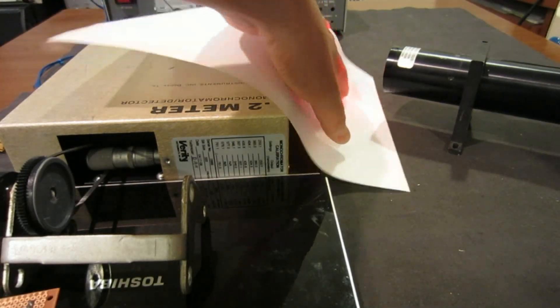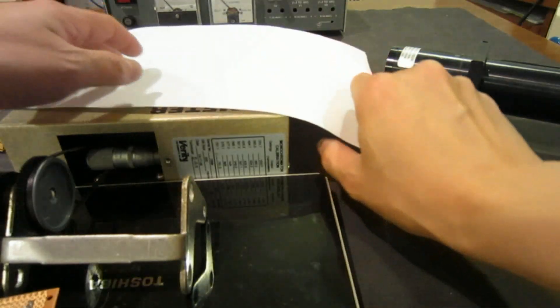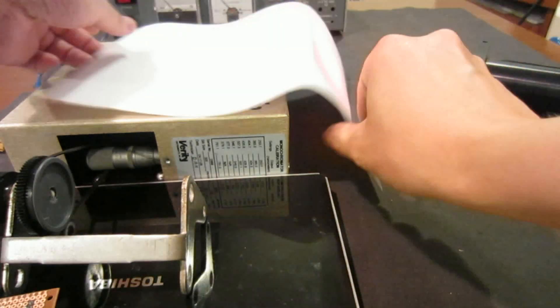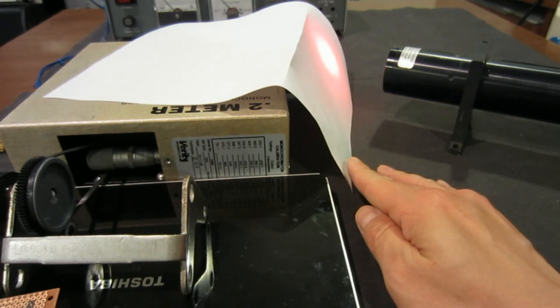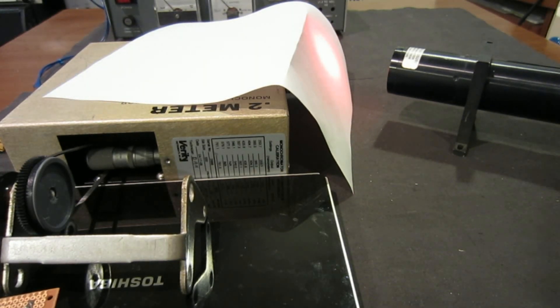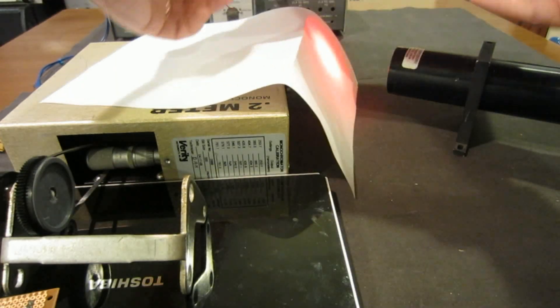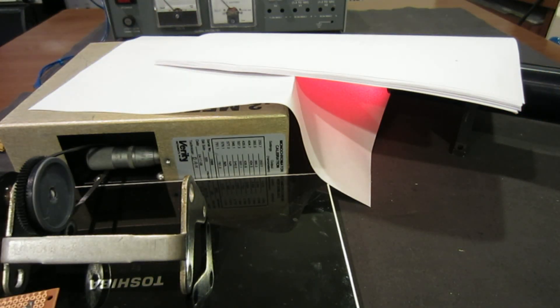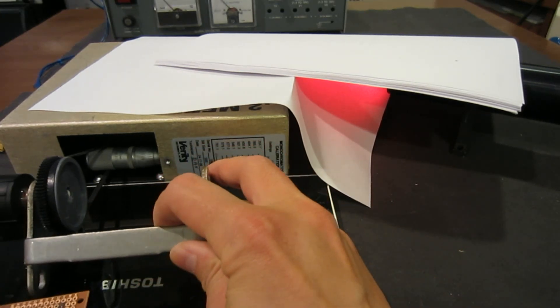I also put a little piece of semi-transparent tape over the lens to make it a bit diffused. I probably still need to put a piece of paper over the monochromator so that it doesn't get totally overwhelmed. That should be good enough. Now I'll also cover the top even though this condition will not be very ideal because we still have light all over the place, but I just want you to be able to see this.